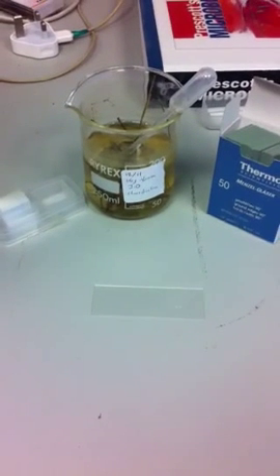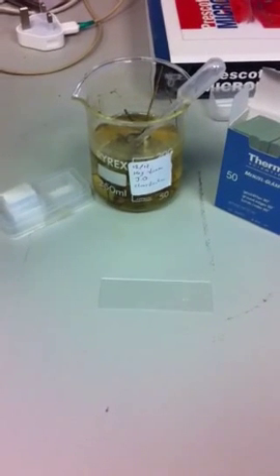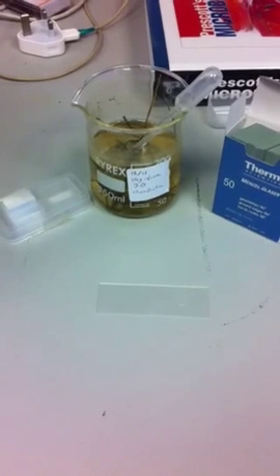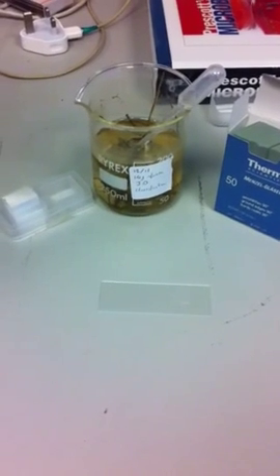Ok, this is a video tutorial on how to make a slide to put into your microscope.